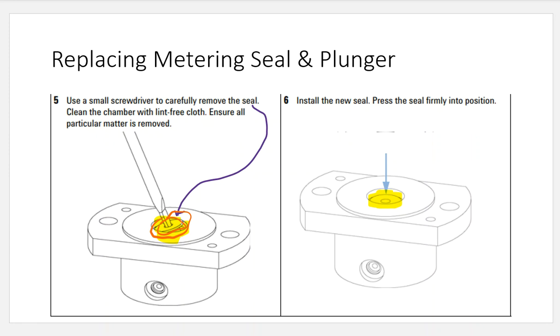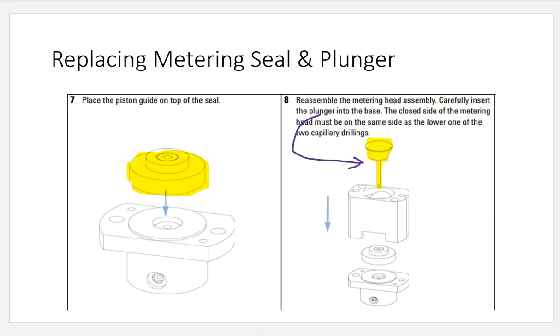So we're going to pop out that old one, and then again we just push in the new one. You can do that with your fingers or with the help of the tool if that's what you want to do. On top of that new seal, you're then going to place the piston guide on top and just make sure it seats in the proper location. And then the top half of that analytical head is going to slide down on top, and it's going to line up with those holes. You're then going to put the plunger back in. Again, make sure you inspect that for damage. Now's the time to replace those if you have to.